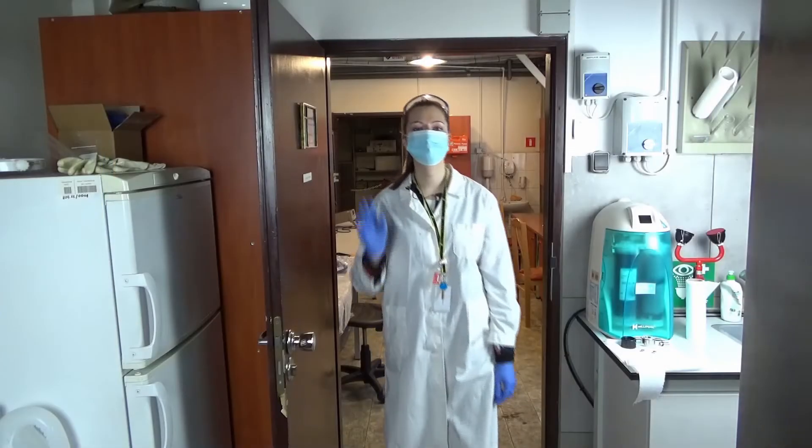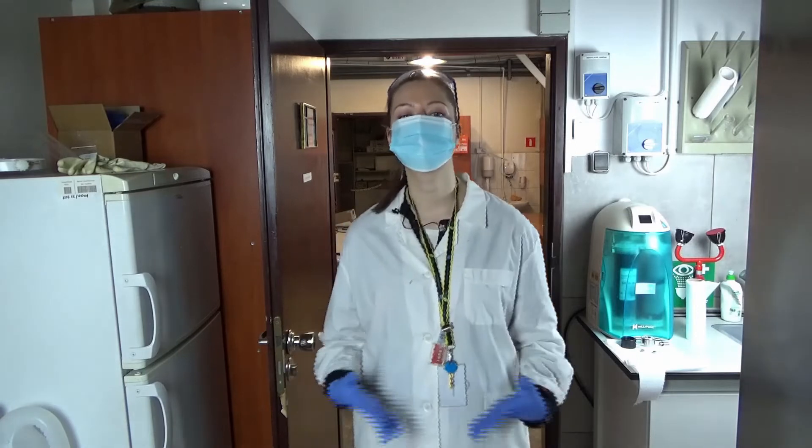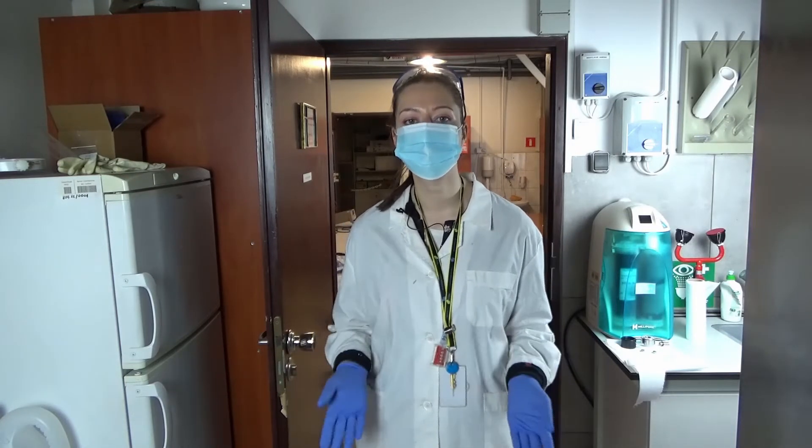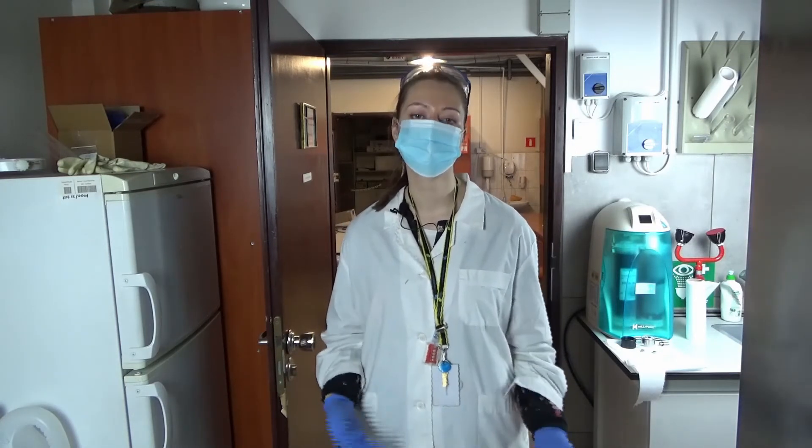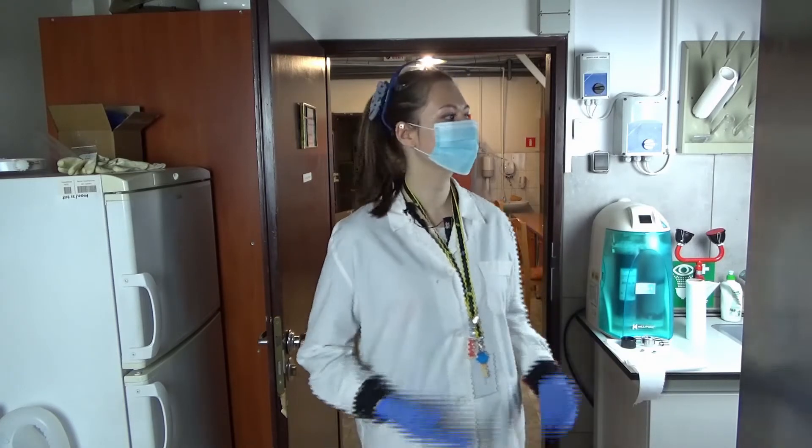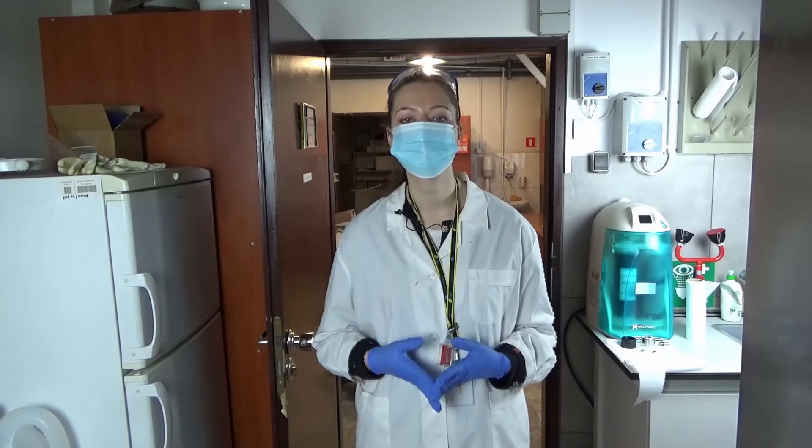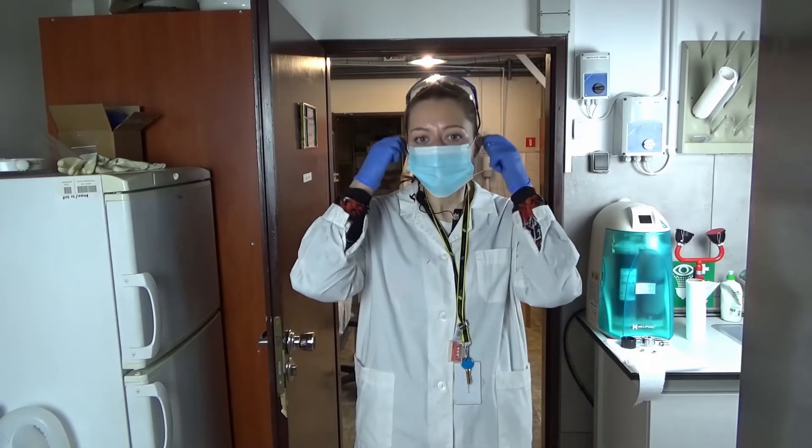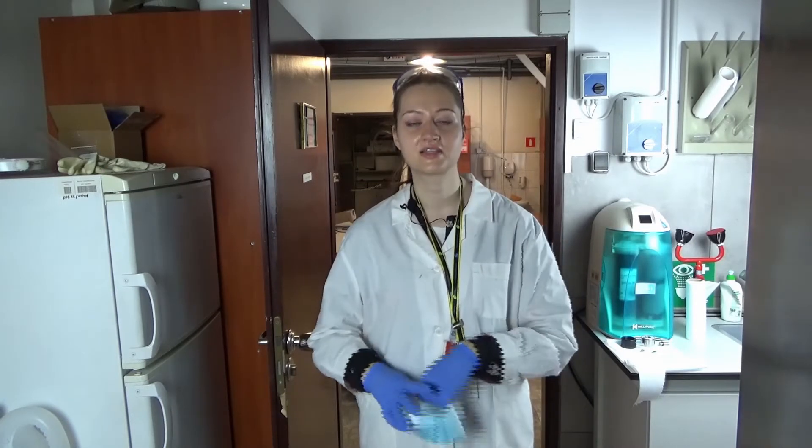Hi, I'm Victoria. Welcome to our chemical laboratory in the Institute of Nuclear Physics, Polish Academy of Sciences in Krakow, Poland. Even in this pandemic situation, because I'm here alone, I think I can take my mask off. In spite of workshops, I'd like to show you how to perform your own synthesis of the prospective chemotherapeutic drug. So let's begin the synthesis.